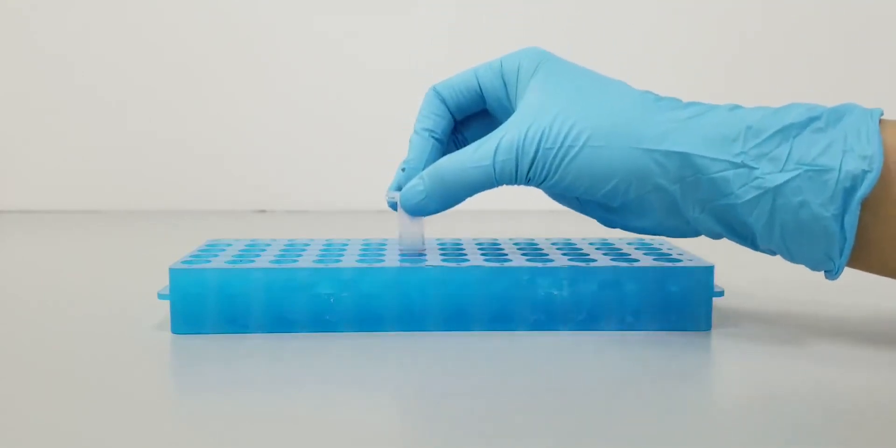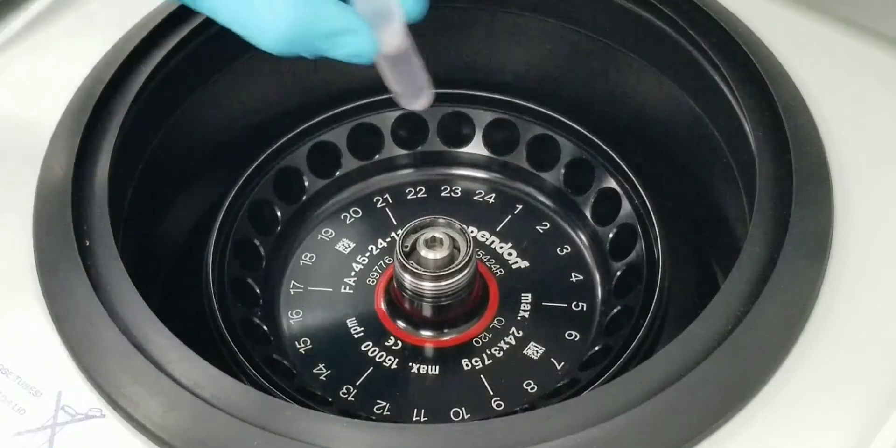Incubate the tube at room temperature for 5 minutes, then centrifuge at max speed for 10 minutes.